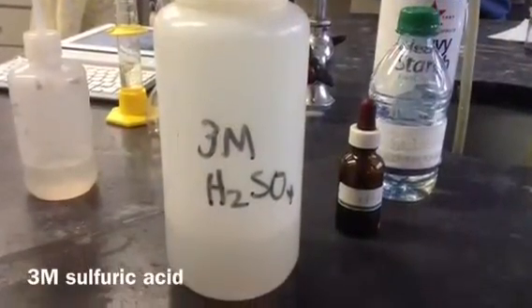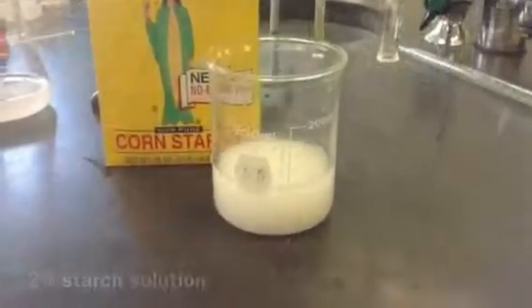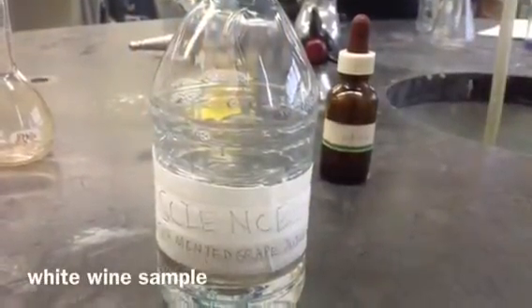Using the Ripper method of titration, sulfur dioxide will react with iodine in an acidic environment, and once all of the SO2 has reacted, the iodine then reacts with the starch indicator, signaling the endpoint of the titration.